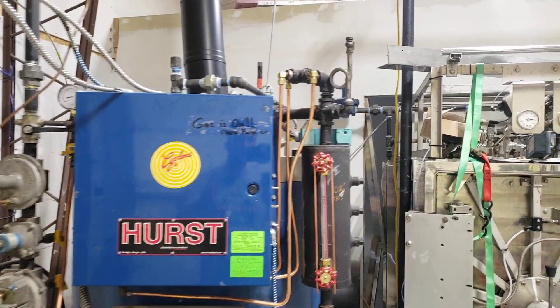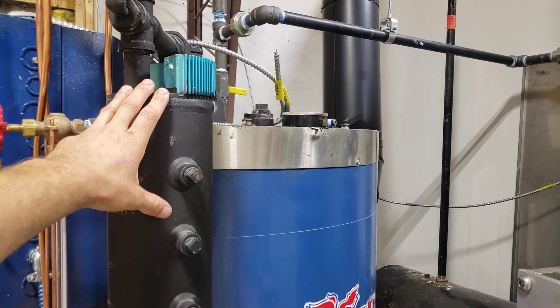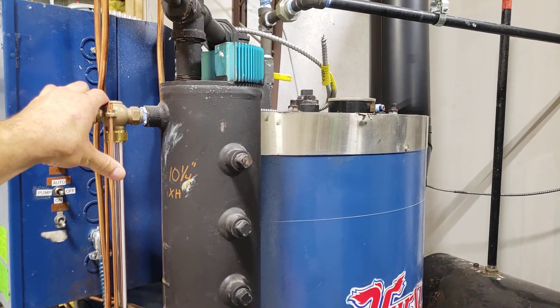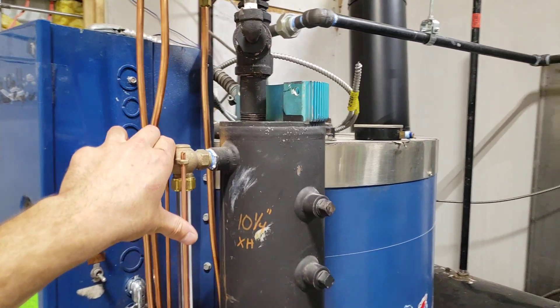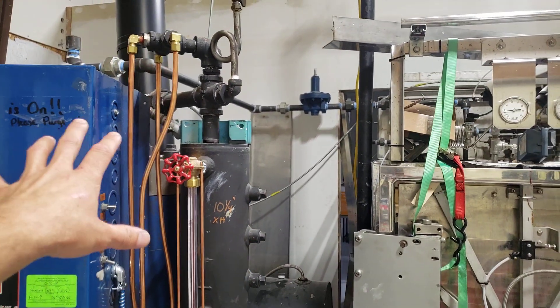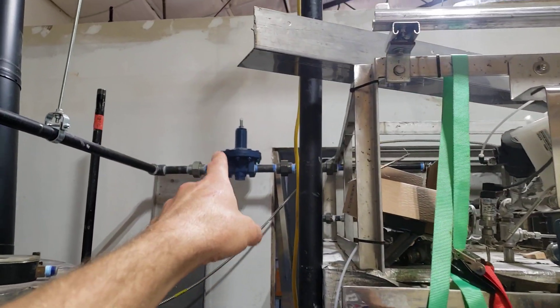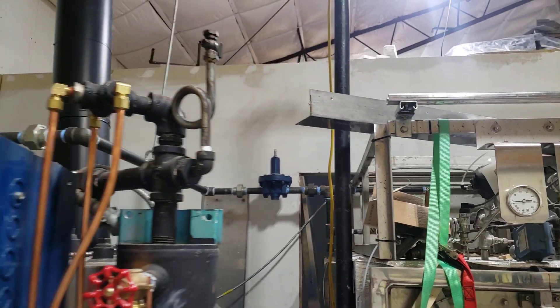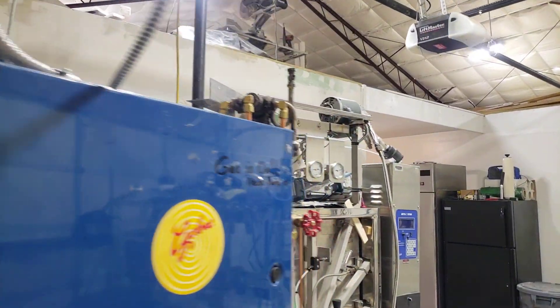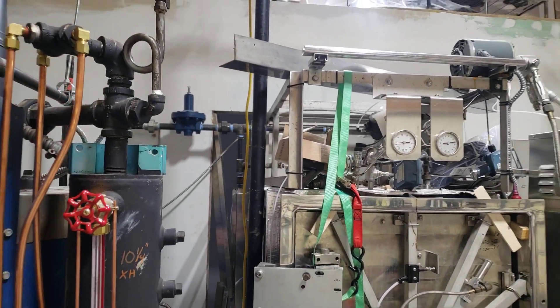Once you have that done, you're going to want a pressure regulator. This is a high-pressure boiler — up to 150 PSI — but I'll be running it around 30 PSI. High-pressure steam is very hot, and when you regulate the pressure down it doesn't lower the temperature, giving you very dry steam, which I want to avoid. So I'm running 30 to 40 PSI at the boiler and 15 PSI at the regulator — that regulator runs about $700. You'll also need new relief valves, which are about $300 each and must be replaced every two to three years; they have date stamps and ASME certification.